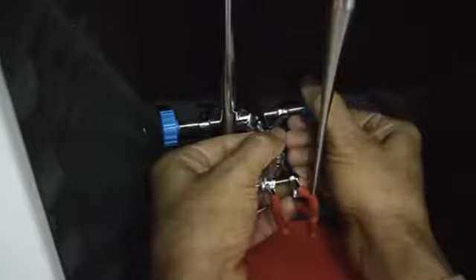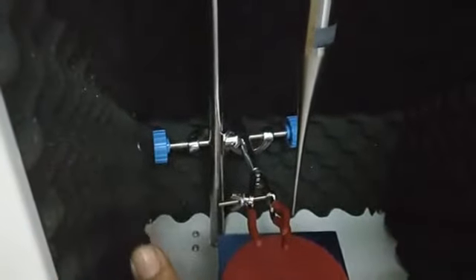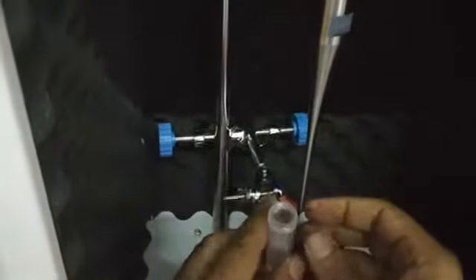This is one part of the assembly, and you can see there is one more rod. What we can do is we can tighten this rod here. There is one clip. This clip part we can tighten on the right-hand side like this. If we are having a small vial, we can push it inside and tighten here like this.